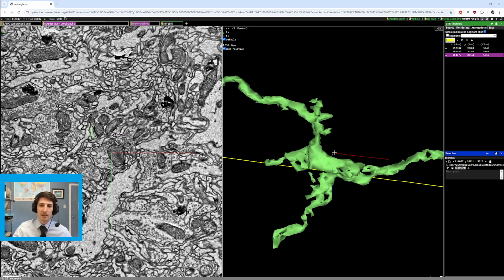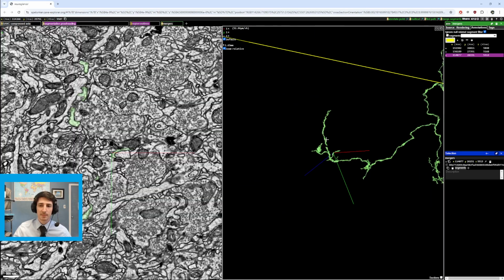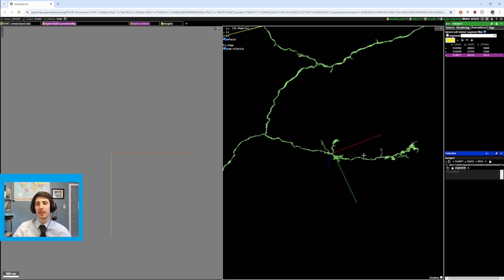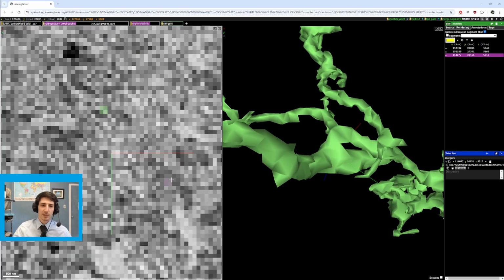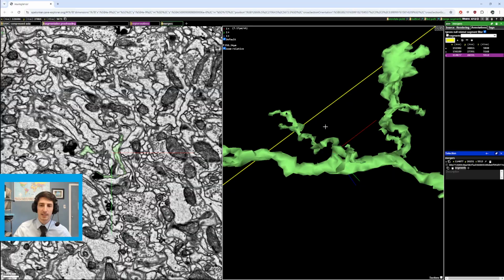And they add up, so you can get rid of that, you can get rid of this. That kind of ends there. But that got me curious to look around. I mean, there's other stuff like this, which can make it difficult to distinguish a merger because this is also perpendicular, right? So why isn't this a merger?